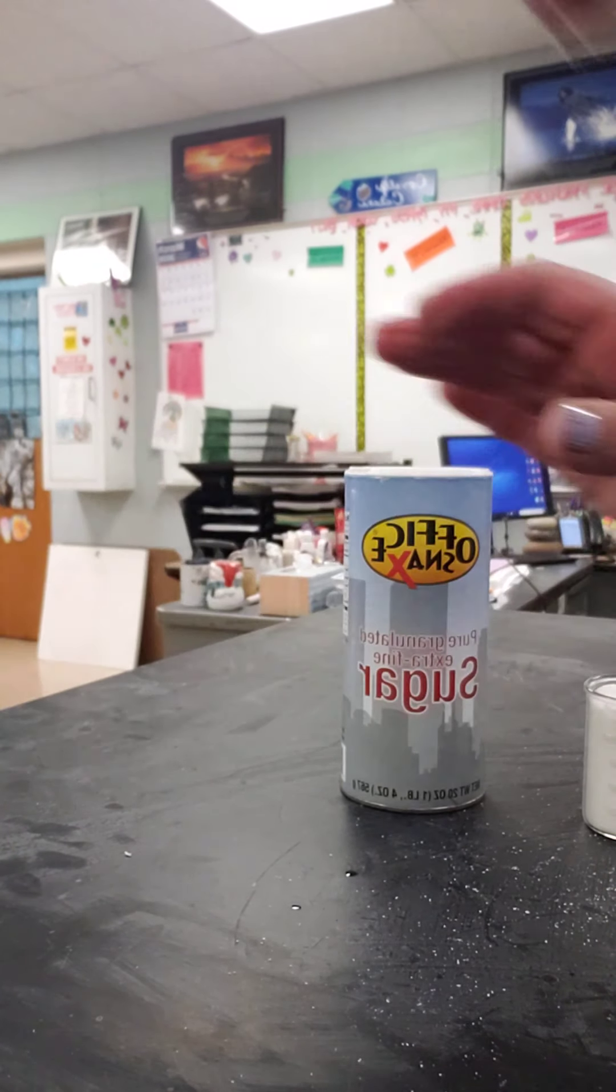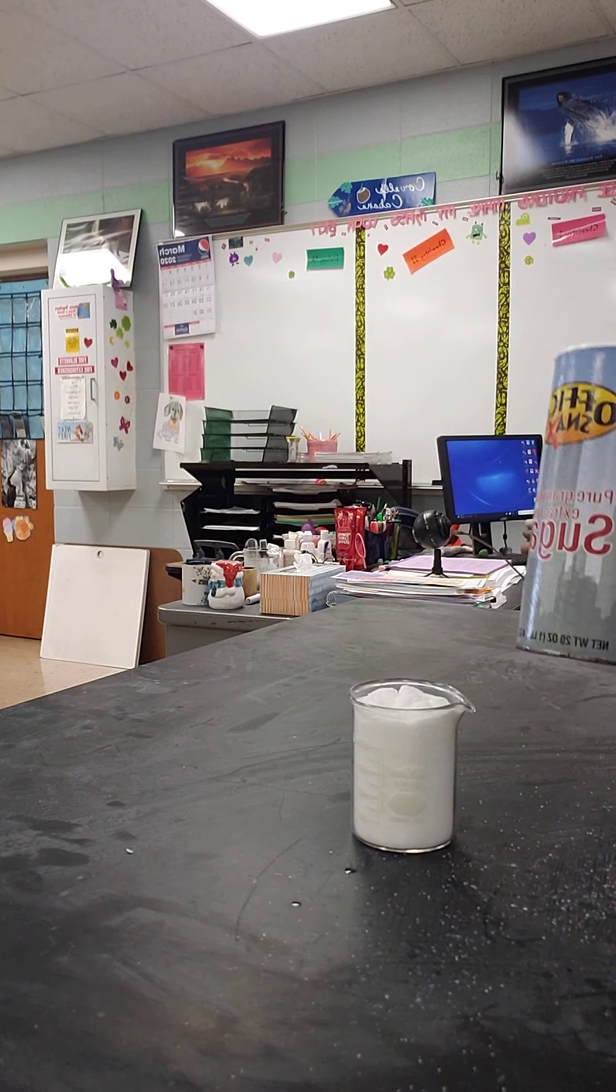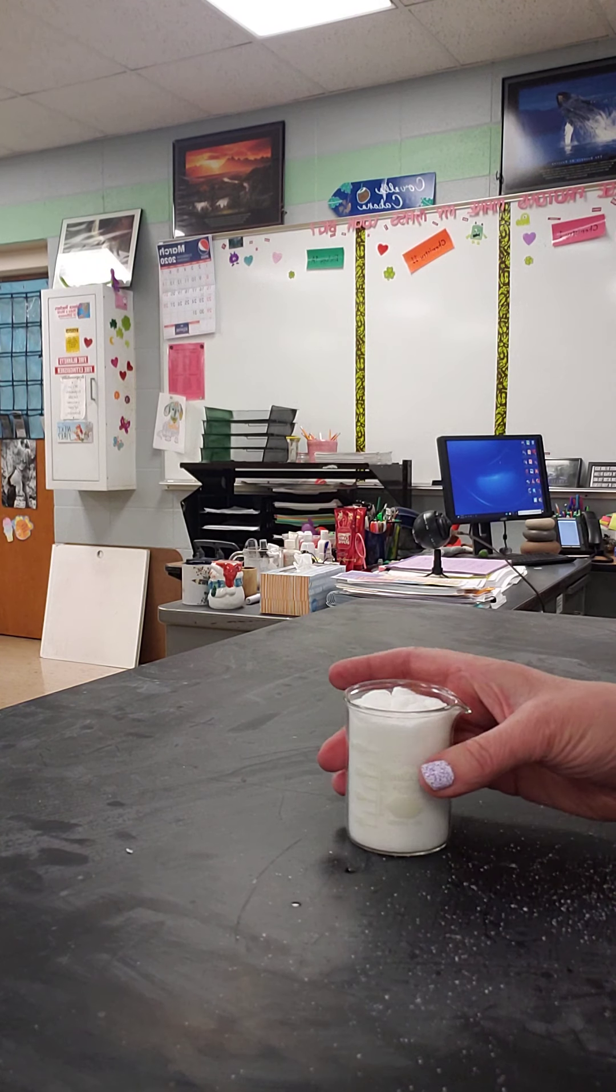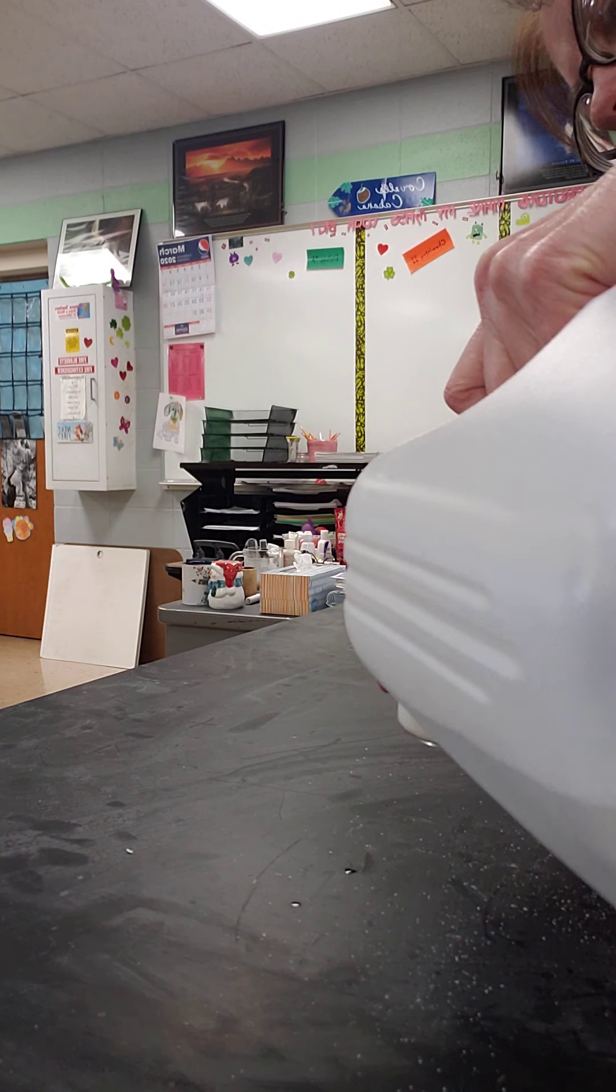Now, I'm going to take some sugar here and show you how it can be broken up to release energy.